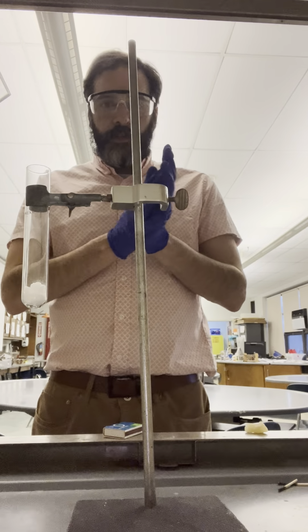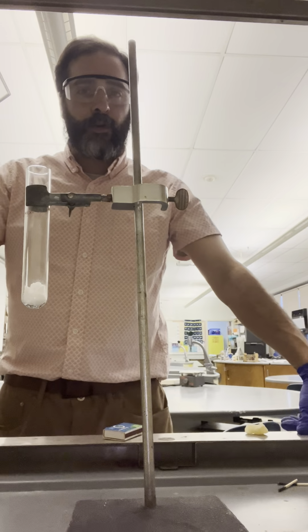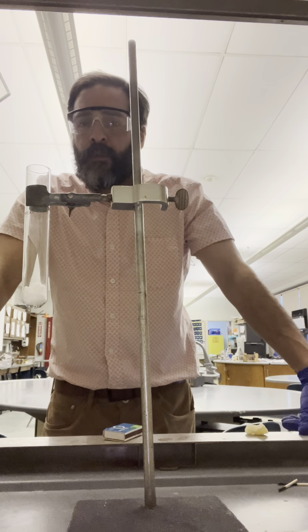Alright, welcome to Chemistry with DeVito. We're going to do a two-part chemical reaction in this video.